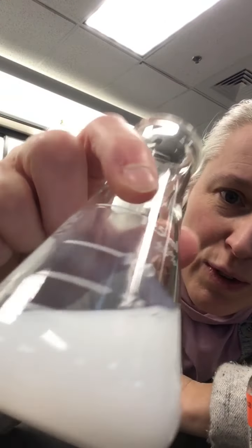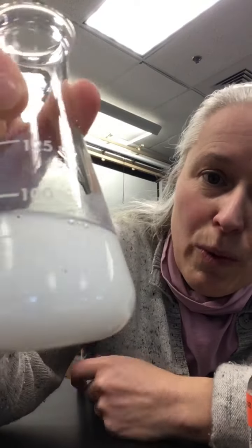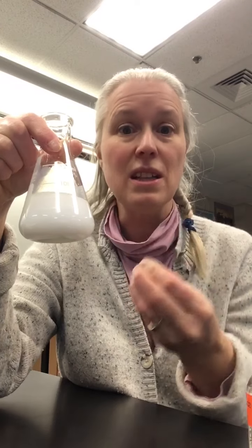And not only that, if you look closely, you'll see sort of slime forming on the side of the glass. Essentially what we've formed is a precipitate of carbonate. So we now have precipitated a solid out of 2 liquids. So this is the process of precipitation, which is the chemical process of forming a solid out of solution.